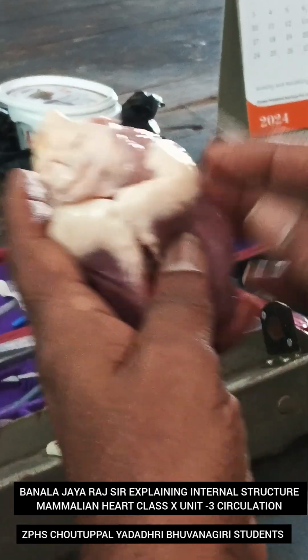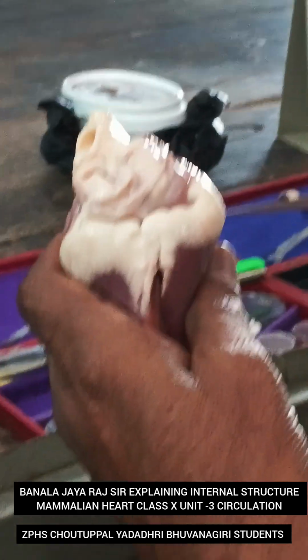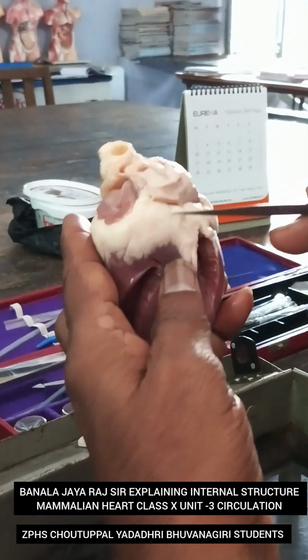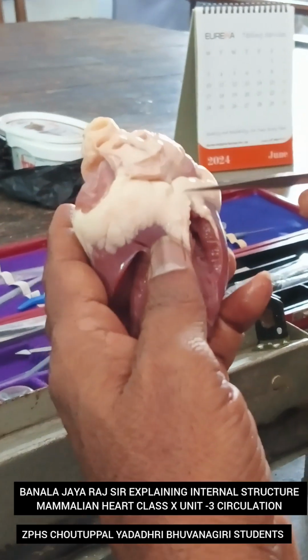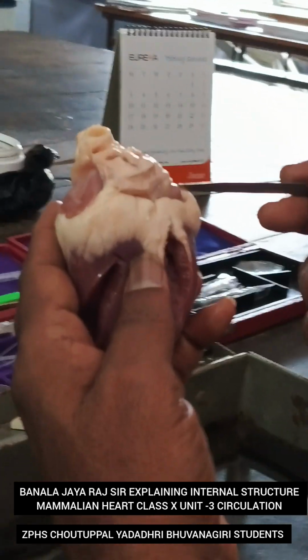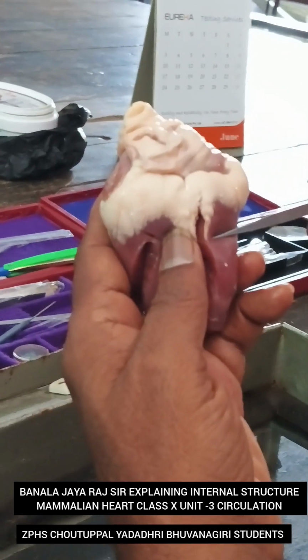So here you see the presence of what? White part. This is nothing but fat, a fat layer. In the same way, our heart also has four chambers. Upper chambers are called auricles. Lower chambers are called ventricles.